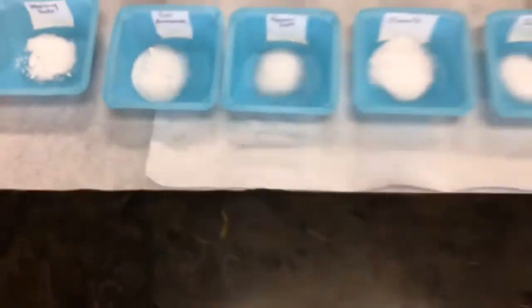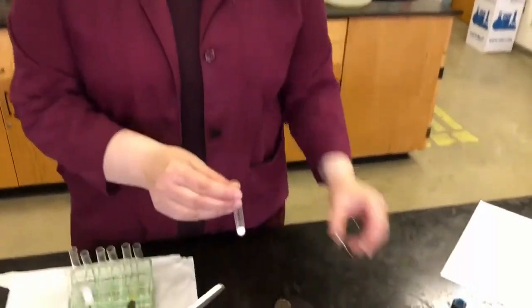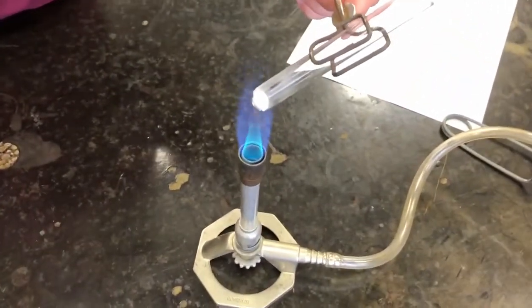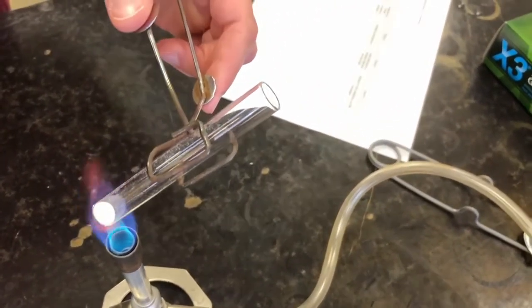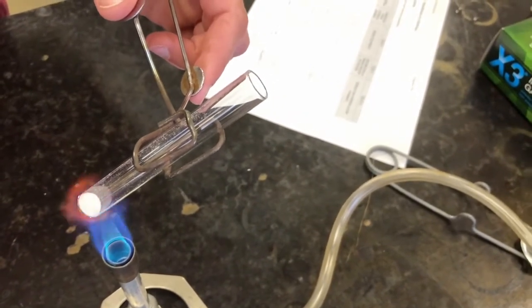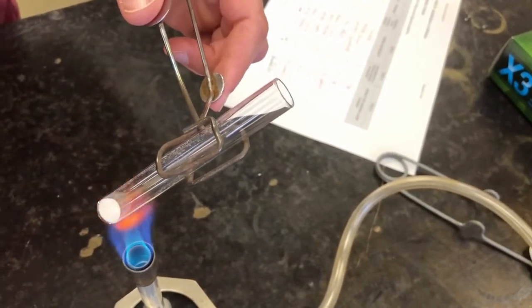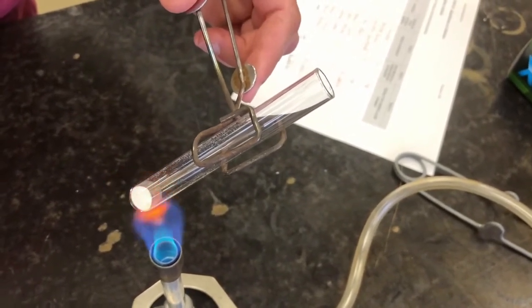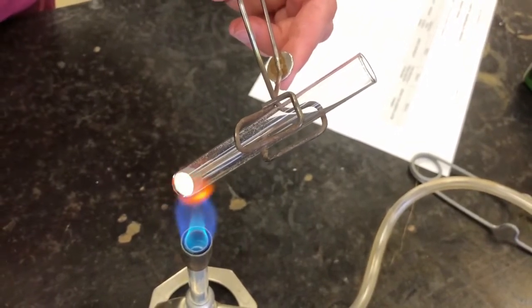Okay? So I have some of that unknown sample measured out in a test tube ready to go. So the first thing that we did is heat it over the flame. So let's do that again. Again, a small pea-sized amount. And let's see if there's any effect of heat. And so far, I don't see any effect. We'll just give it a couple more seconds. So I don't see anything happening. So I think we can conclude that there is no effect of heat on this unknown substance.